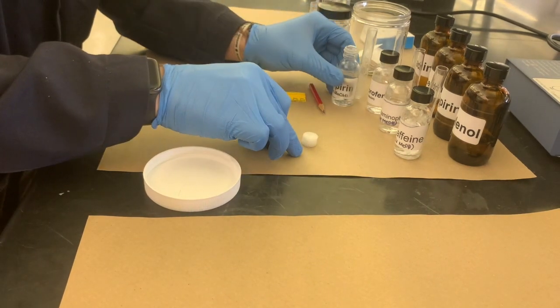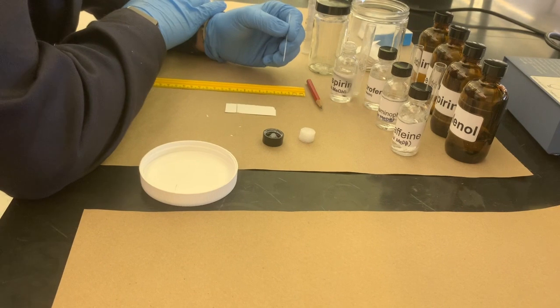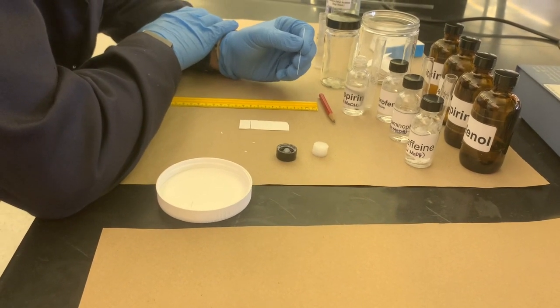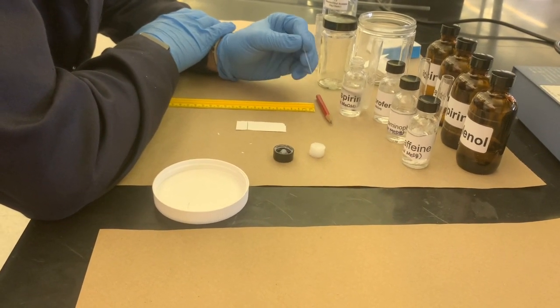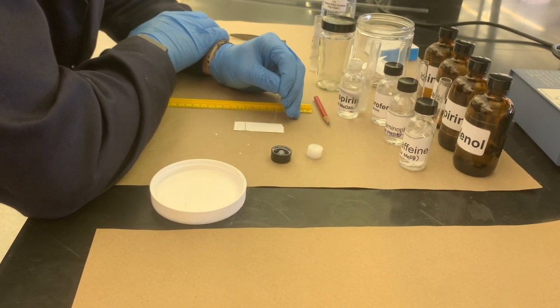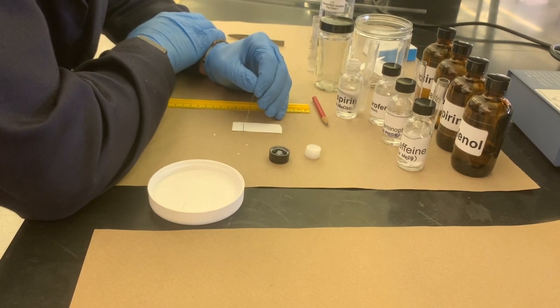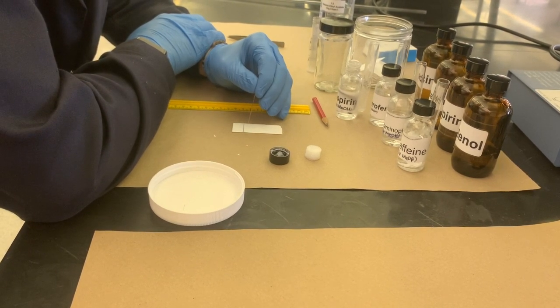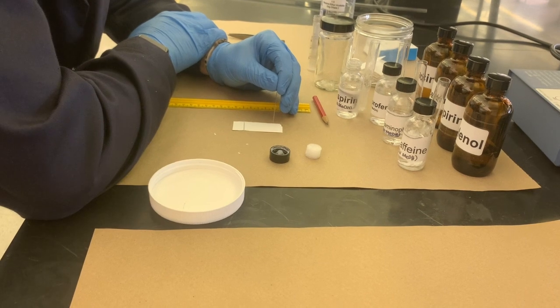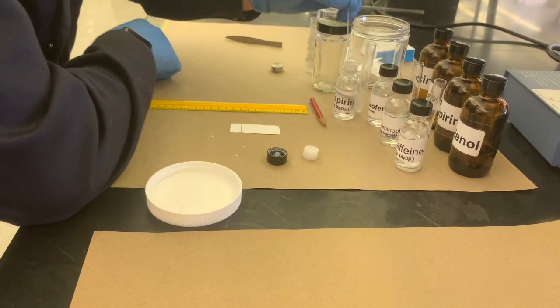And in general, if you have time beforehand, you always want to work with an extremely dilute sample when you're doing any kind of TLC. You don't want a gigantic spot on your plate. You want a nice, small place where your sample is moving from. You want a nice, small spot where that sample ends up in the final product.